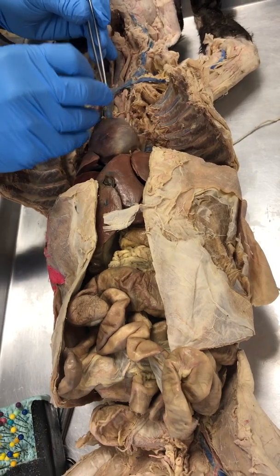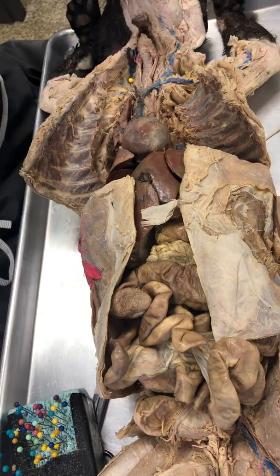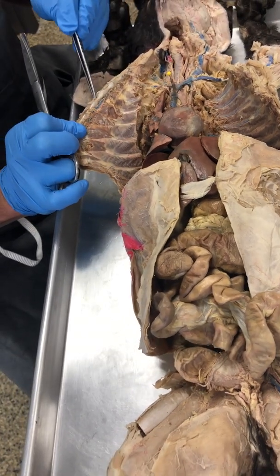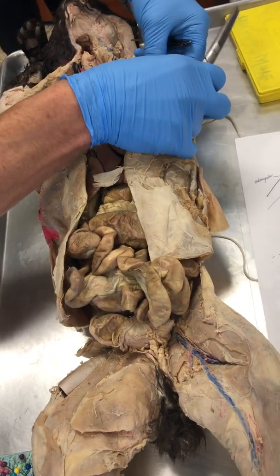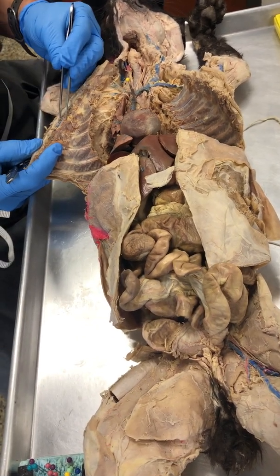Right there. And this cat, the way it was dissected way back in time, we can see nicely what letter do we see there again? Y. Because there, ladies and gentlemen, is the internal mammary vein on that side of the sternum, and there is the internal mammary on this side. So all of this is internal mammary vein. Next to it is the artery.